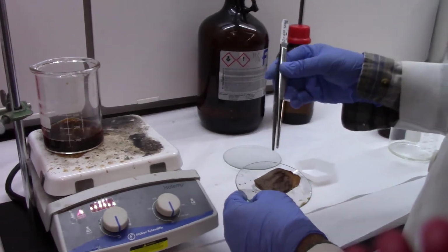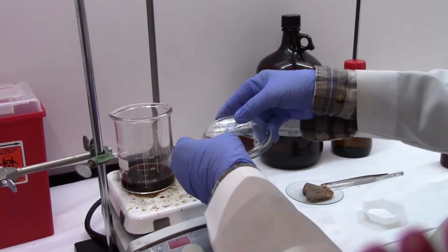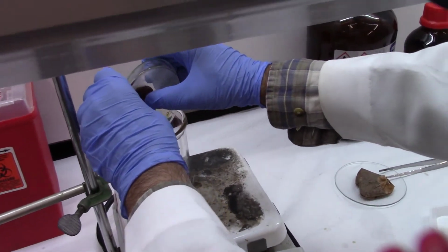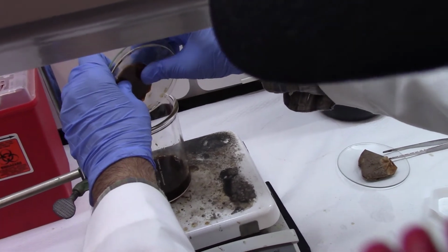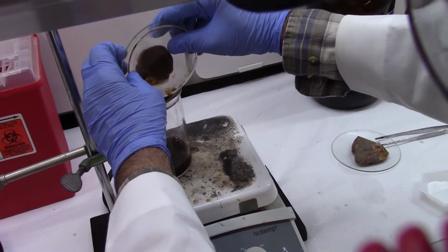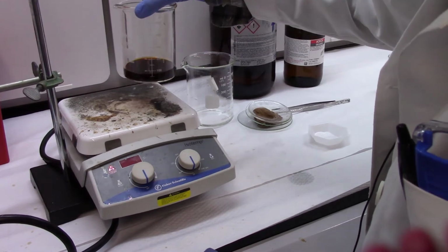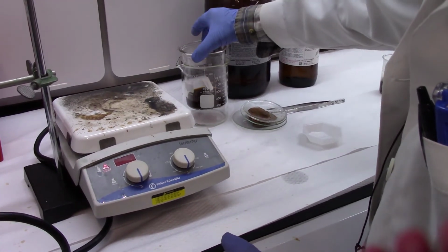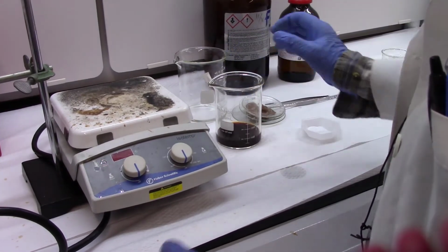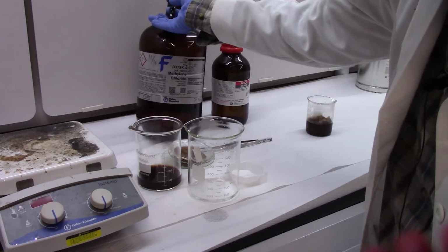Alright, so you assume that all the tea has been prepared and the caffeine has been extracted already, and all you got to do now is cool the beaker to room temperature. The best way is to cool it in an ice water mixture, only not to 0 degrees, only to room temperature. So take some ice water mixture in a beaker and put the beaker containing the solution in it to cool it to room temperature.